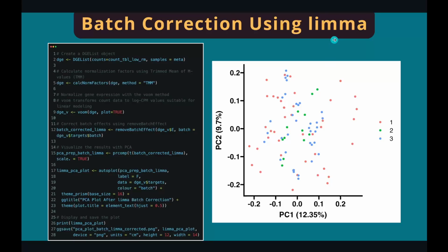The next method is from limma. That's why I like limma, because limma is so versatile. It can do a lot of things. So as usual, in limma, we have to create a DGEList object by combining the gene expression matrix and the meta table. Then we normalize the gene expression data and call another function called removeBatchEffect. This function accepts the gene expression matrix and the batch information and returns another gene expression matrix with different values.